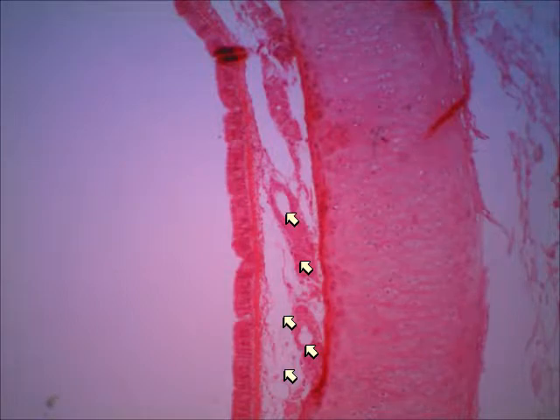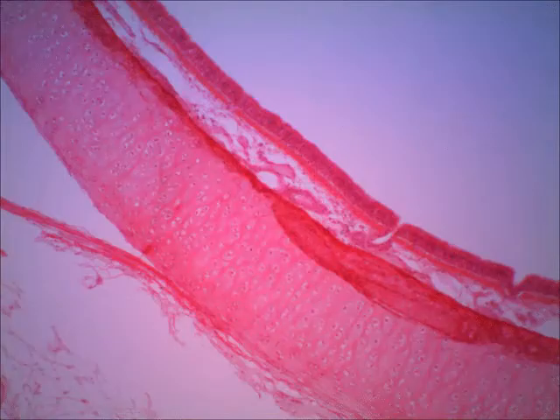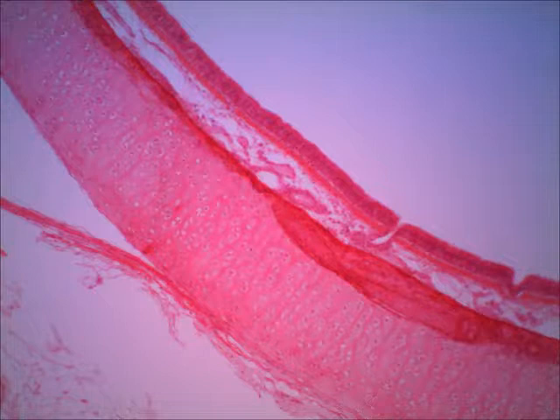Now, on the next slide, this is of the same magnification, but it's just a different position on the slide. So I don't want you to get used to, say, the epithelium being on the left side or on the right side. Pretend like you were actually looking through the microscope, which is what you're doing here. But just imagine that you would be moving it around. See if you can locate the cartilage on this slide.